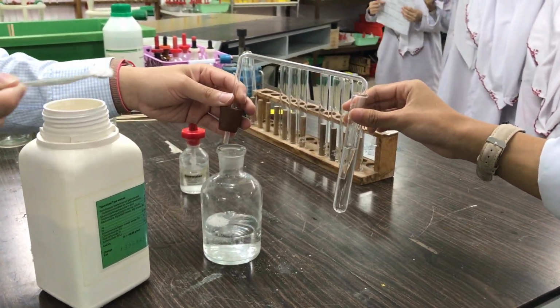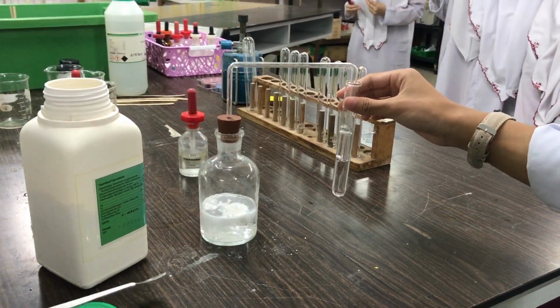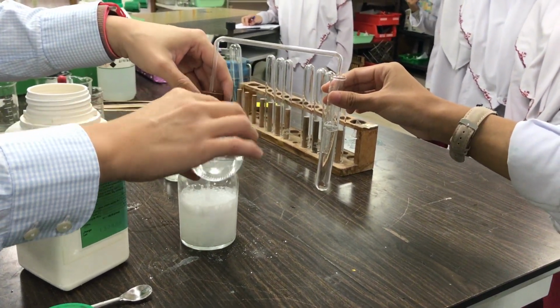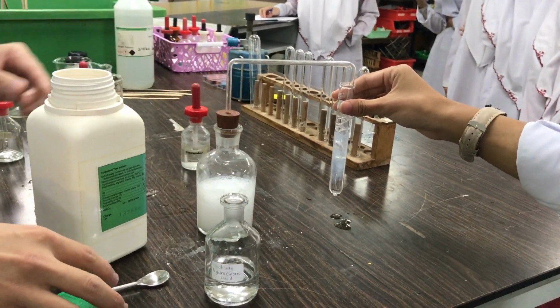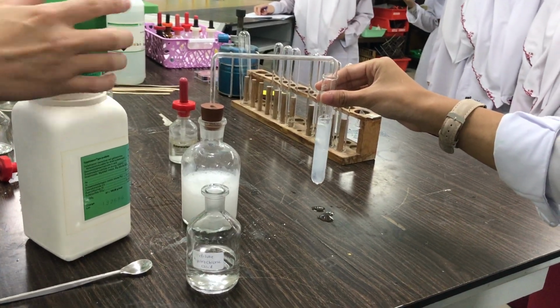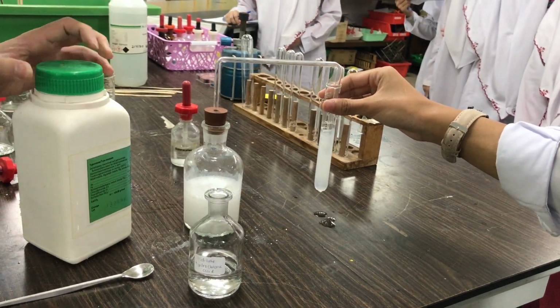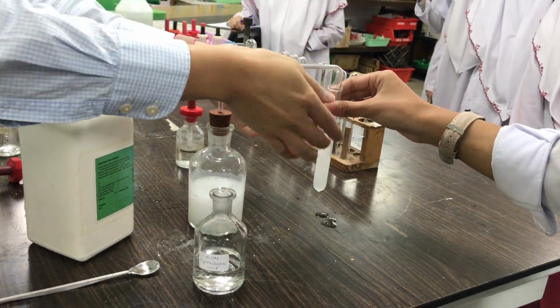I want to add a lot more carbonate inside here, and at the same time, I want to add a lot more acid. I want to show you the effect of carbon dioxide. Don't worry, it's just lime water. What do you notice in the lime water? I know, you see bubbles. The gas goes through there. Last time you used a straw to bubble into lime water, right? Here the reaction produces carbon dioxide, and the carbon dioxide goes into lime water. What happened to the lime water?